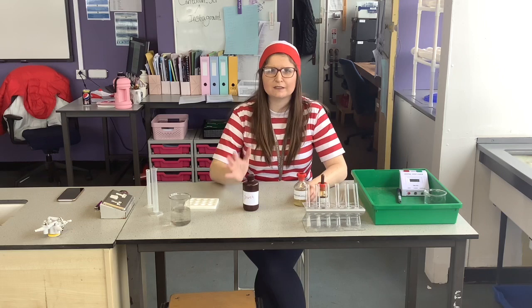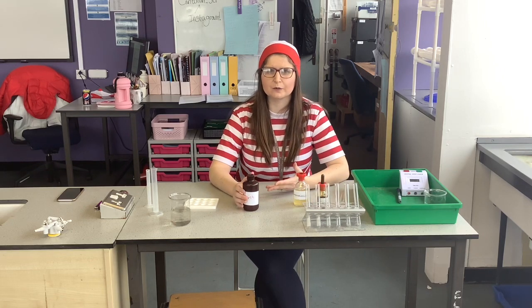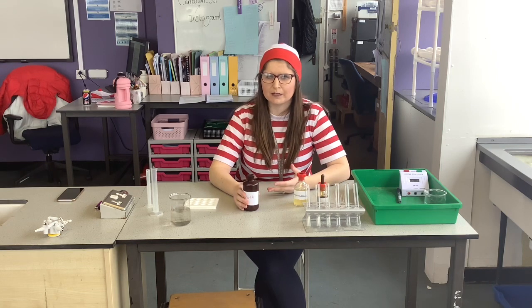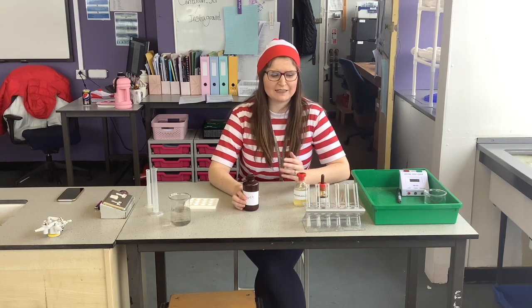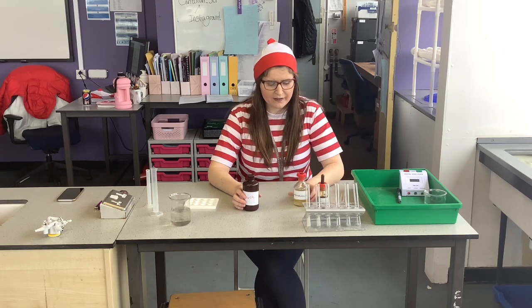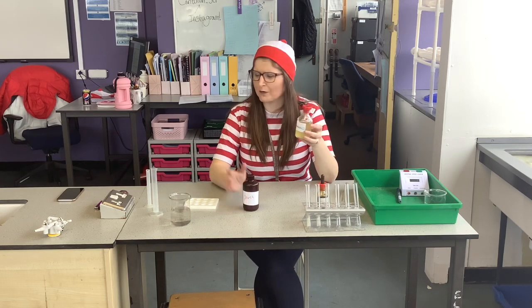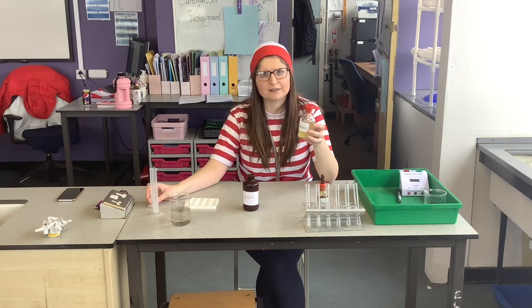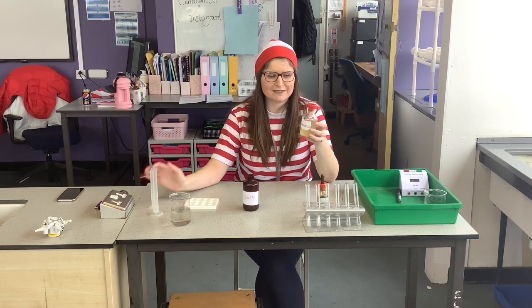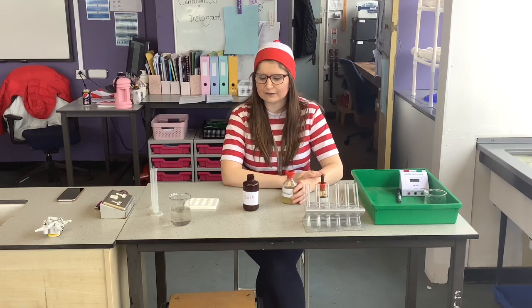With this prac, there are going to be risks. As we're changing temperature, up to 70 degrees, we're going to have quite hot water, so the hazard is that we can burn ourselves. Control measures: we need to be really careful when we're using the water baths at those high temperatures. Another one, our amylase solution is an irritant, so be really careful when pouring it into our measuring cylinders. And if we happen to get any on our hands, wash your hands immediately after.